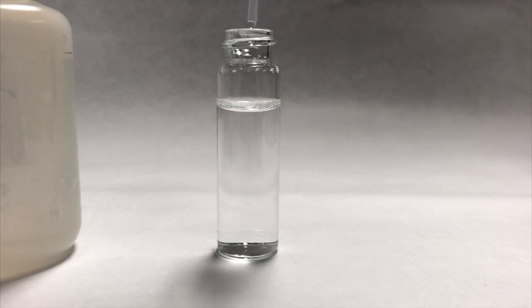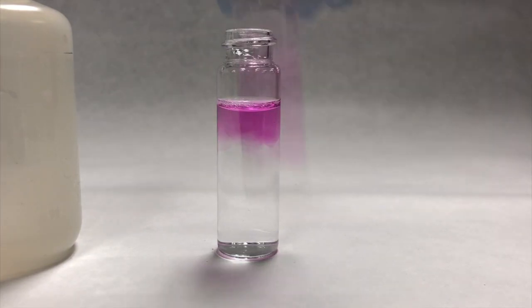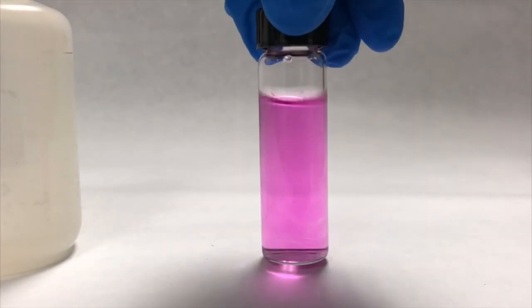In a qualitative test, only small amounts of chemicals are needed for a reaction to occur. Adding just a few drops of an acid or base can change the color of this solution.